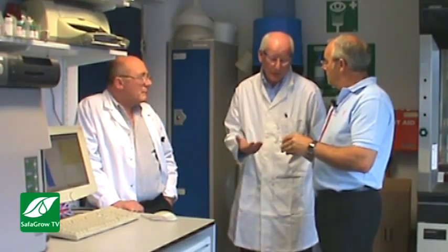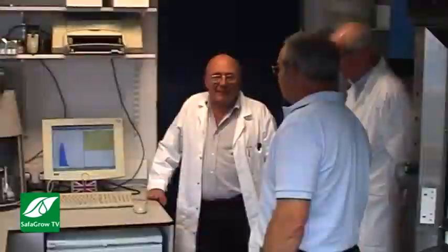How long do they have to stay in that mill to get them down to that size? The flow rate depends on individual products, because we have different specifications and the hardness of the raw materials. But without the calculations, the throughput is somewhere around 800 kilos an hour. That seems a high output to me. Quite a high output. They're quite big bead mills. Yeah. They're about as big as you'll get.